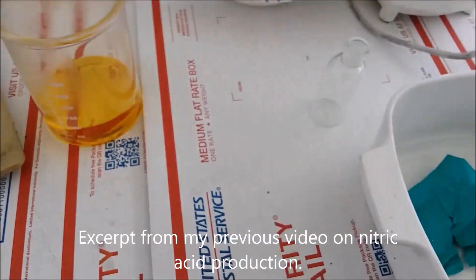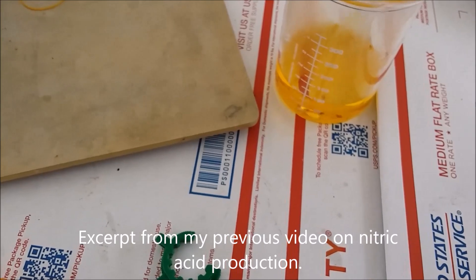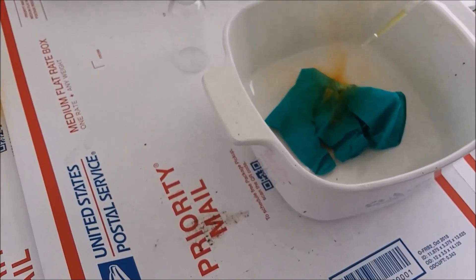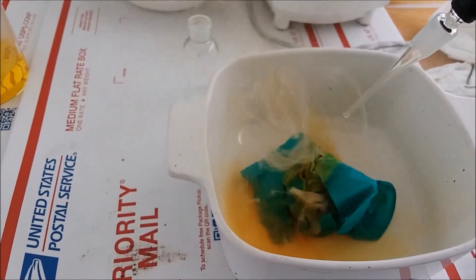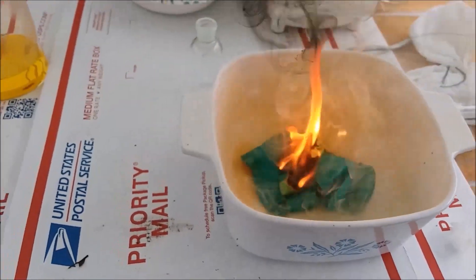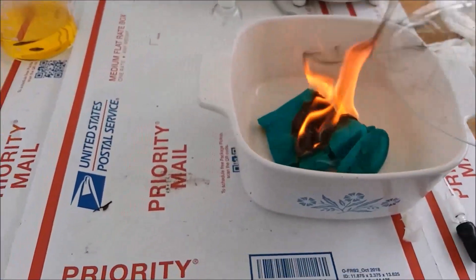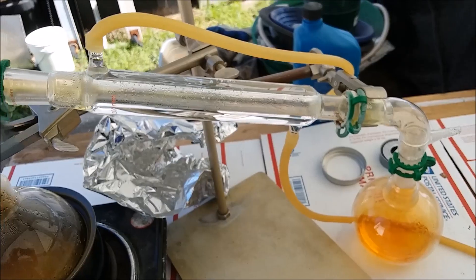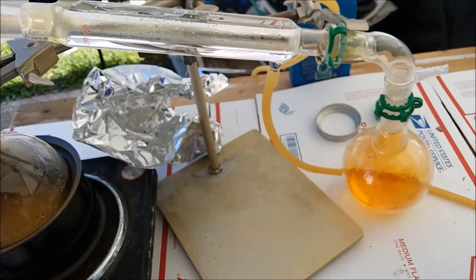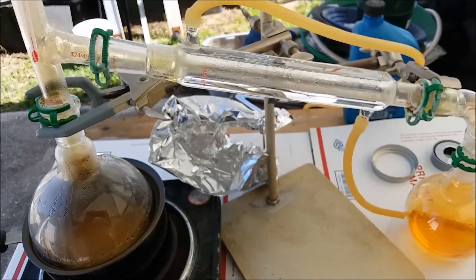I've got some leather gloves I'm going to wear, because we all know what happens when concentrated nitric acid and nitrile gloves mix. Here's a classic test — I've got a nitrile glove here and I'm just going to put a little of this acid on it and we'll see what happens. Oh yeah — that is some concentrated nitric acid. This is why they say you should not wear nitrile gloves when working with nitric acid. So I'll wear leather gloves.